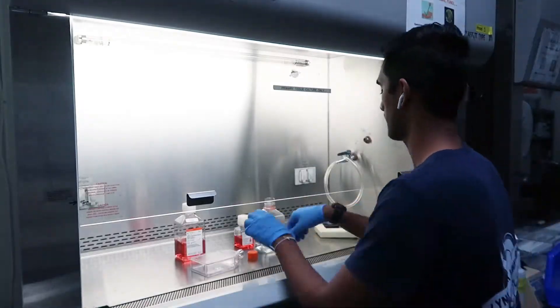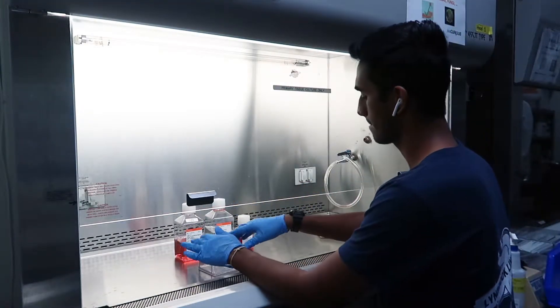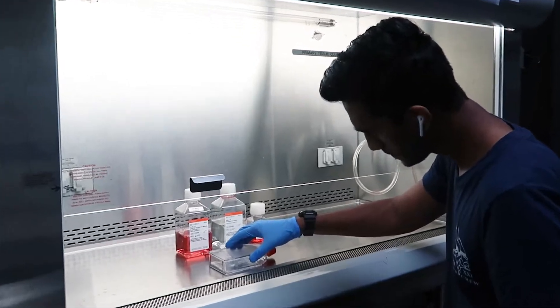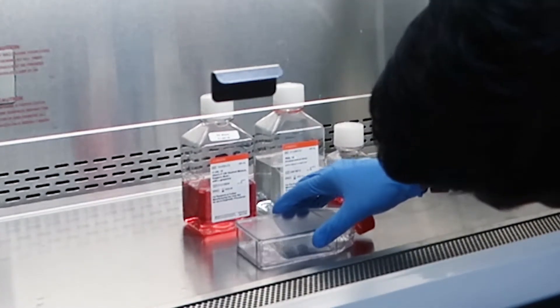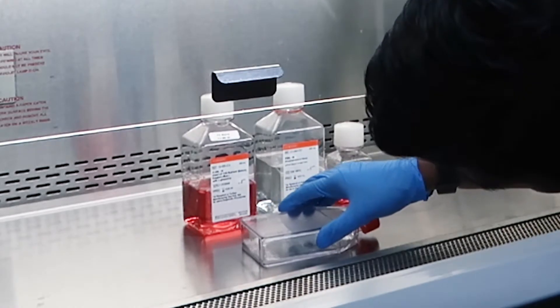Once you dispose of your serological pipette into your biological waste bin, make sure to swivel the flask so that the PBS inside rinses over all of the cells.